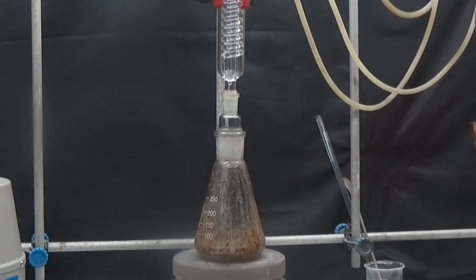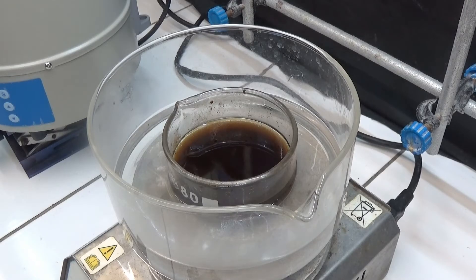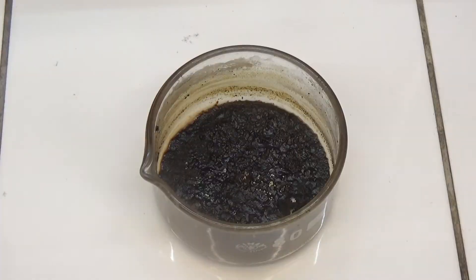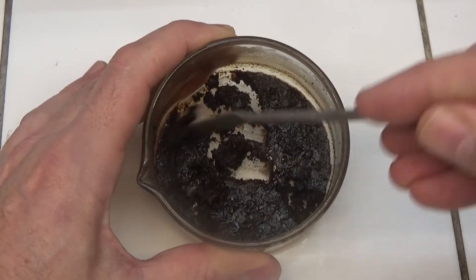As there was a lot of residue left in the flask, I diluted it with ethanol by heating at reflux for a few minutes. The catechol and ethanol solution was placed in an evaporation dish and evaporated in a hot water bath until dry. Now in the evaporation capsule it is easier to remove the residue with a spatula.